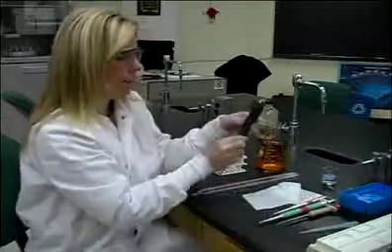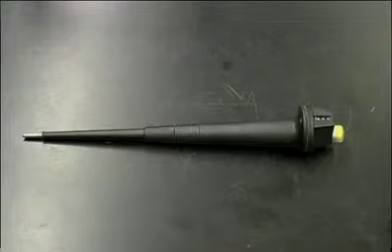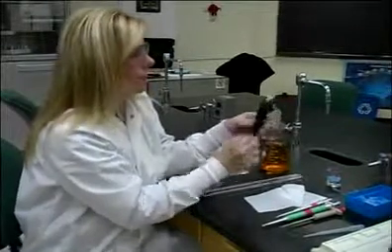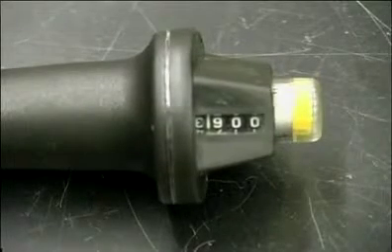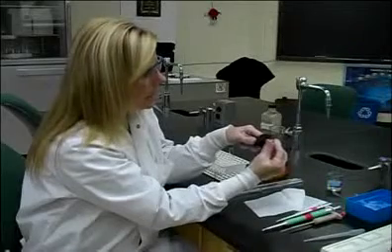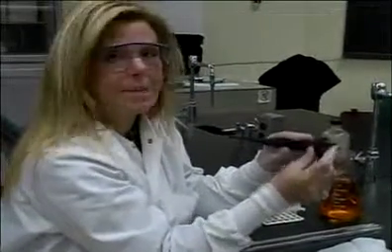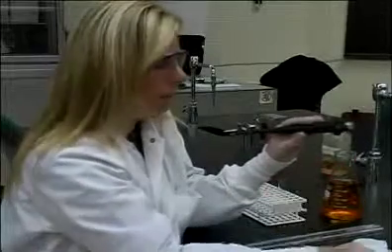Another type of micropipette is an Eppendorf pipette, just a different manufacturer, same principle, same air displacement. This one has a dial on it from 10 microliters to 100 microliters, and again I can dial in for 15.9 microliters, 20.1 microliters, however much I want my volume to be. I can just dial it in, much like my green MLA pipette.